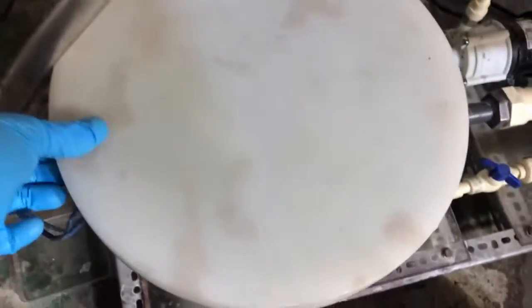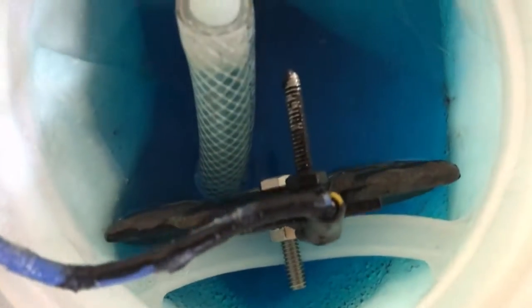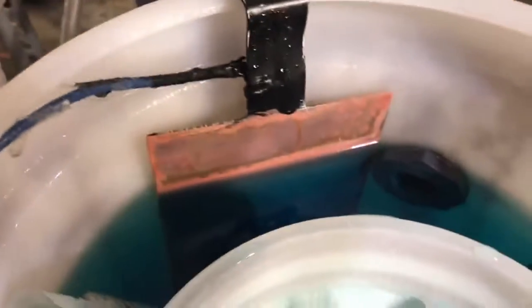There we are after about 12 hours. I wanted to take a look at this crystal — oh yeah, that's got a nice glitter to it. Real nice, clean piece of copper. Got some nodes starting on there. So I had to do a little rearranging. We have the anode in this little bag and the cathode directly across from it.